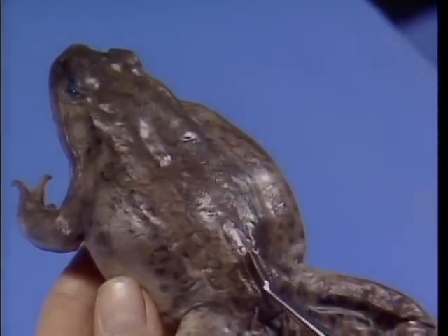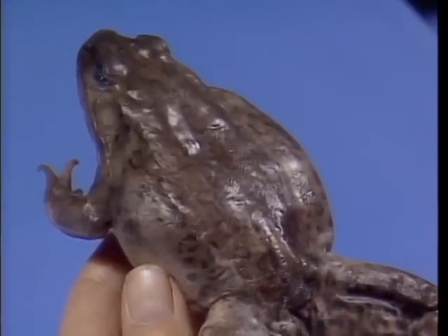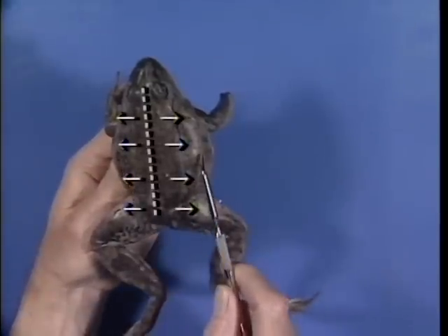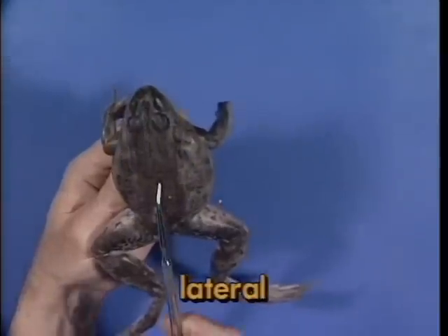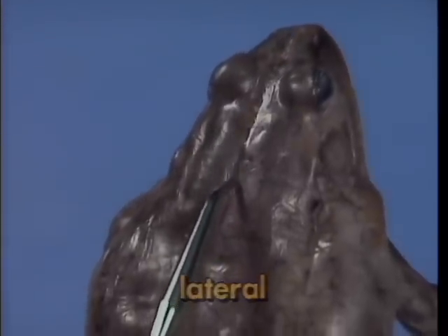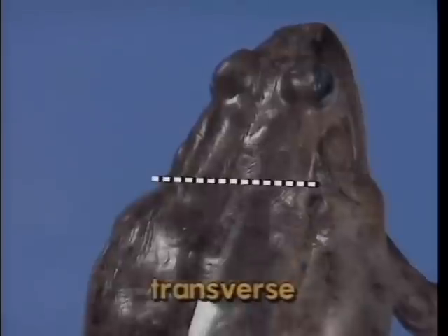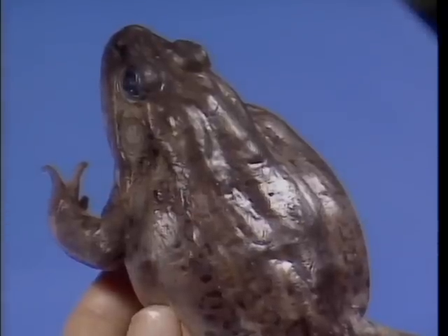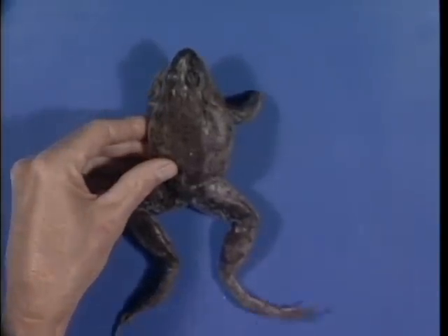along an imaginary line or axis that runs from the tip of the snout to the base of the body. Anything that lies farther out in either direction is said to be lateral. For example, the eyes are located lateral to the midline. Structures that run at right angles to the anterior-posterior axis are said to be transverse to the midline. Often we will make transverse incisions with a scalpel or scissors.